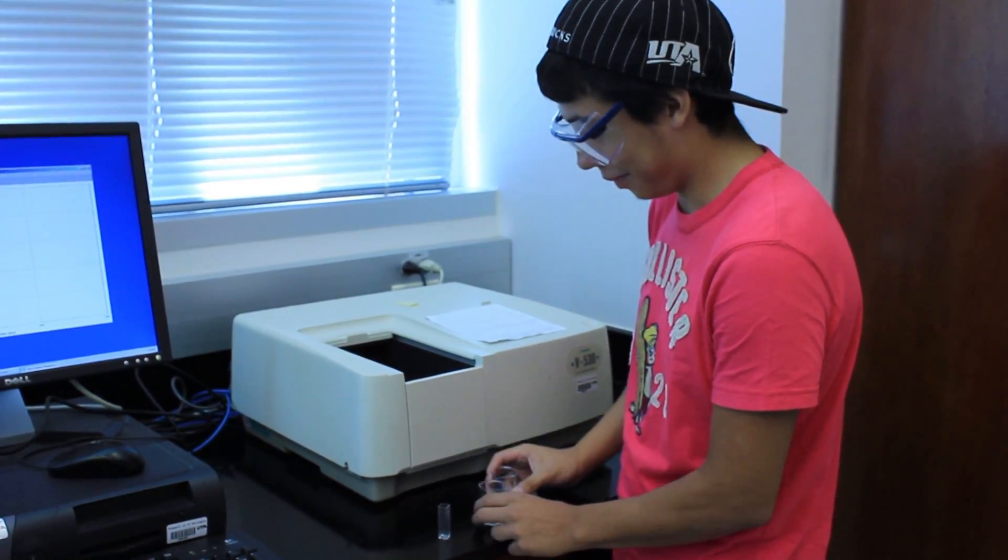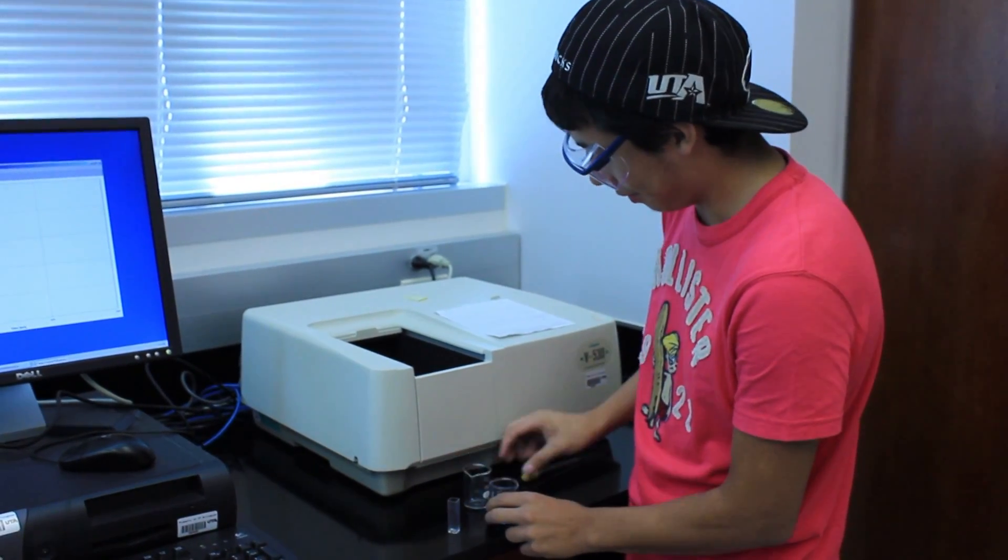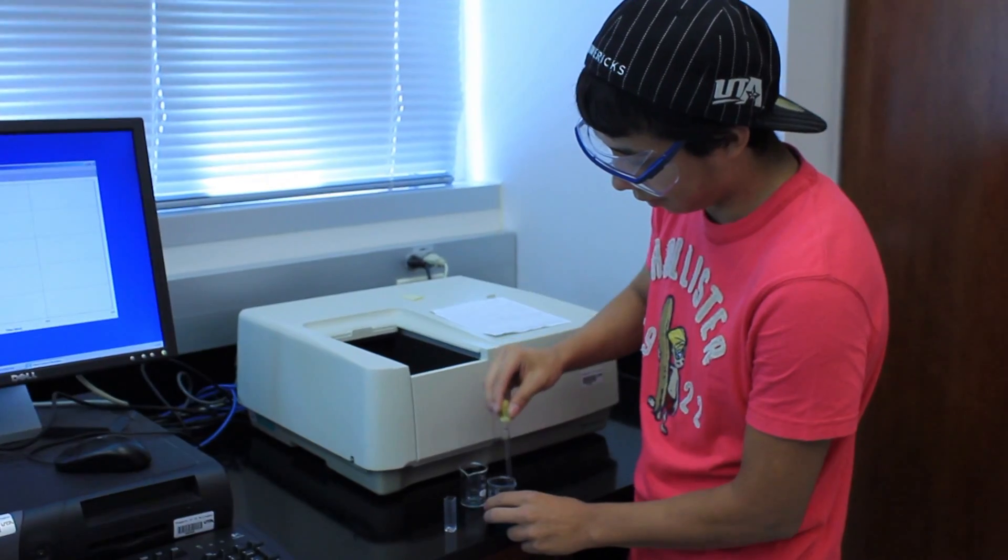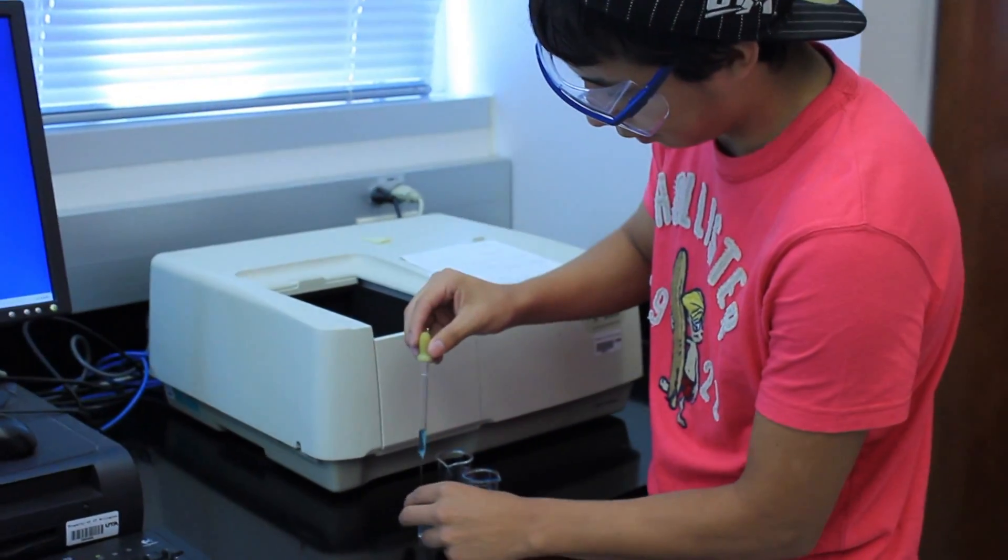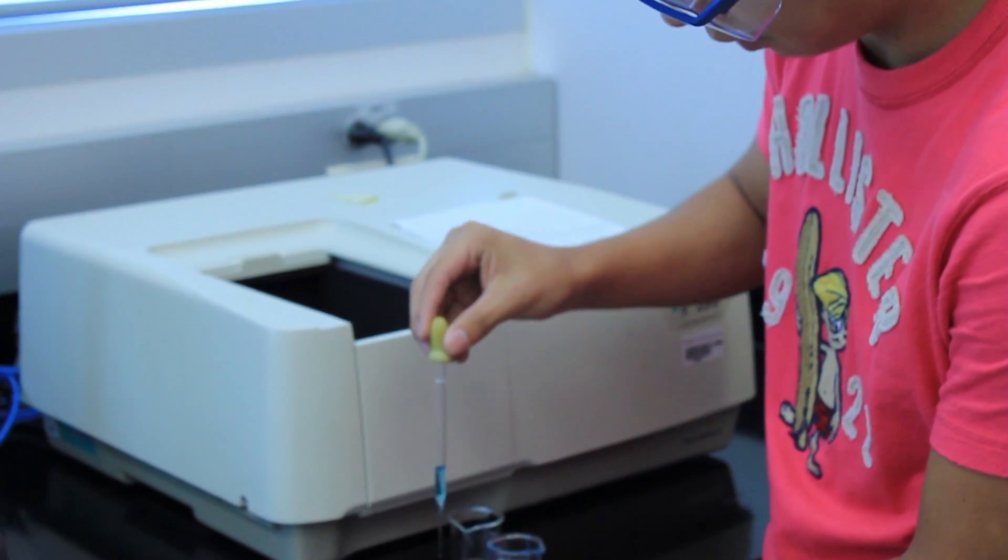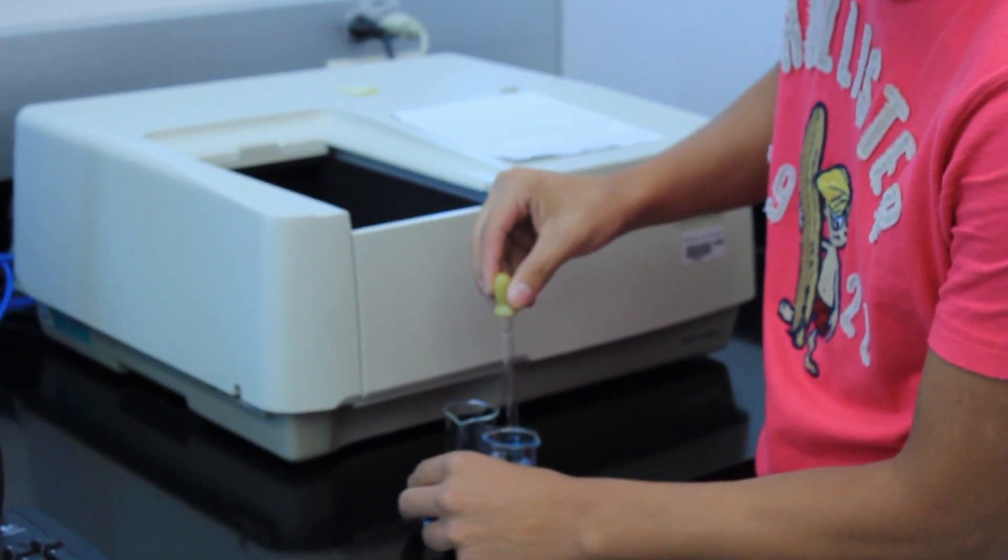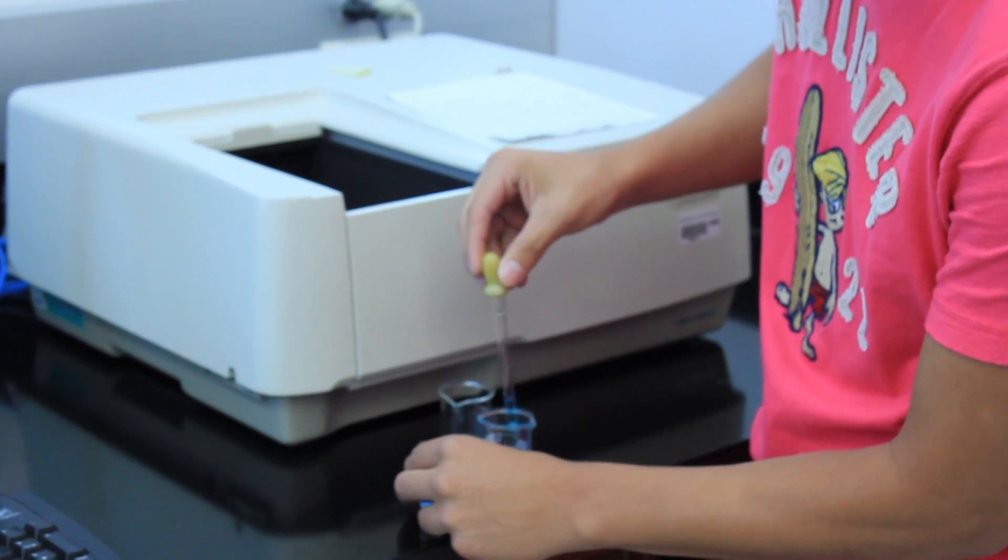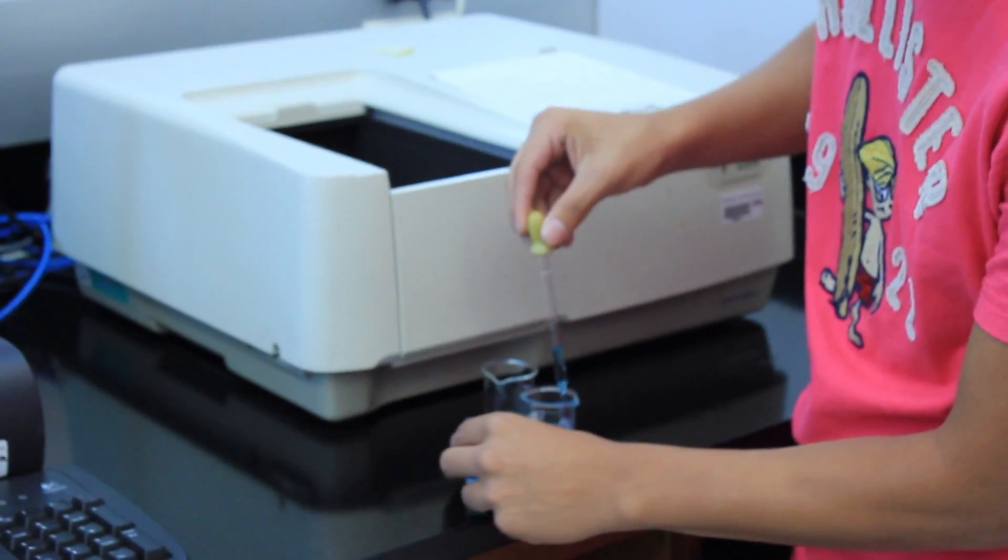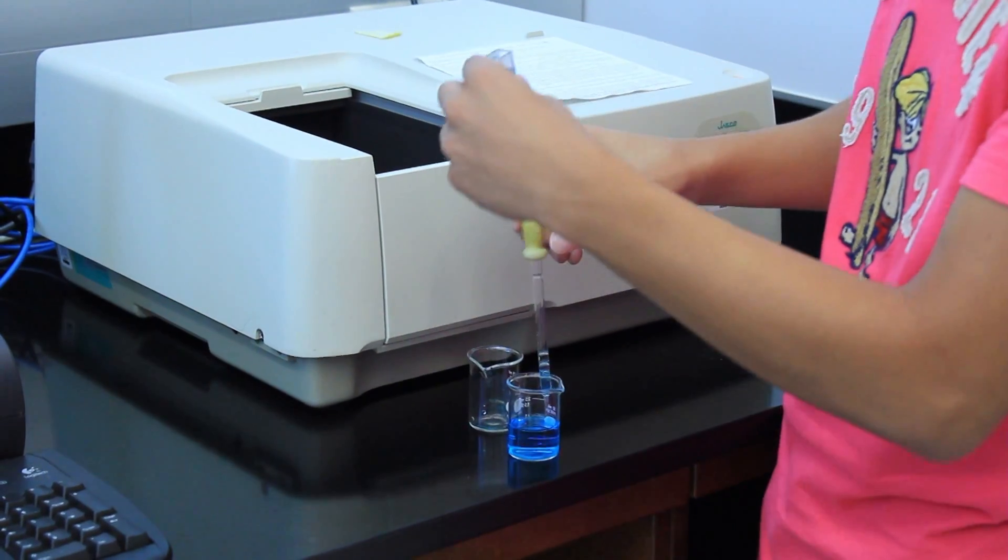So our assistant will do that for us now. And you have to work quickly so that the bleach doesn't completely dissolve all the colors. So you work really fast to fill your cuvette and put it in the machine. Again make sure it's facing the proper direction. While he's doing that you know that you have your machine set to the appropriate wavelength. And once you place it in the machine you quickly close the lid and click start.